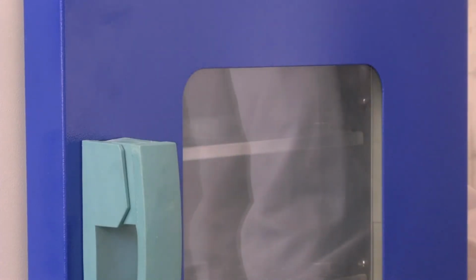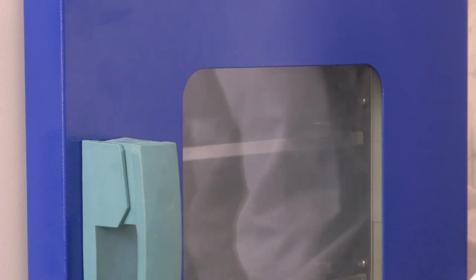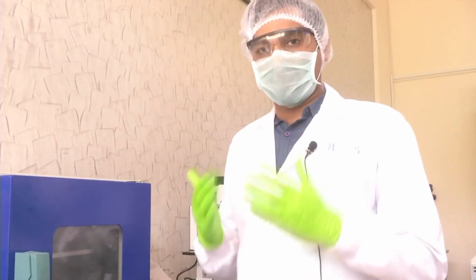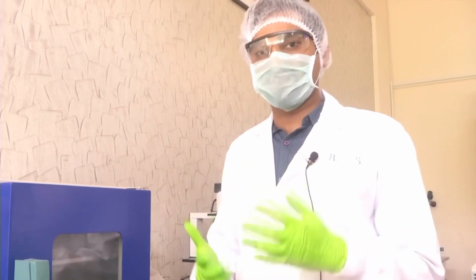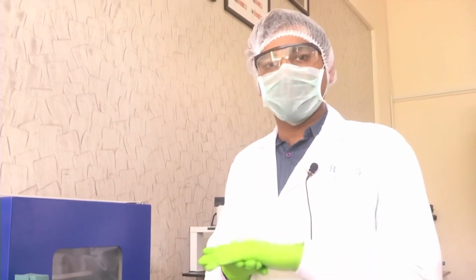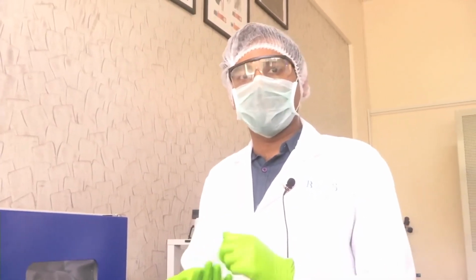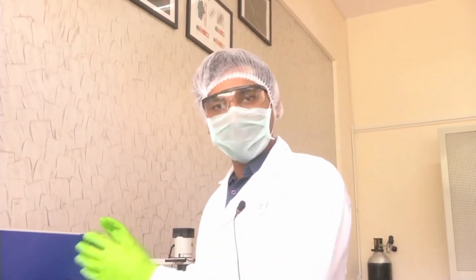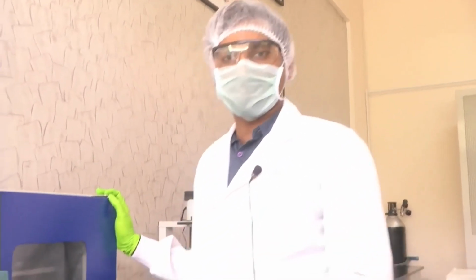So we had prepared PDMS and the curing agent. Air bubbles were there. We removed the air bubbles 2 times. First, when we had prepared the PDMS with the curing agent, we removed the air bubbles from the mixture. Then we had poured PDMS onto the silicon mold, and removed air bubbles from there also using a desiccator. Then we had kept it in the oven for the curing process.